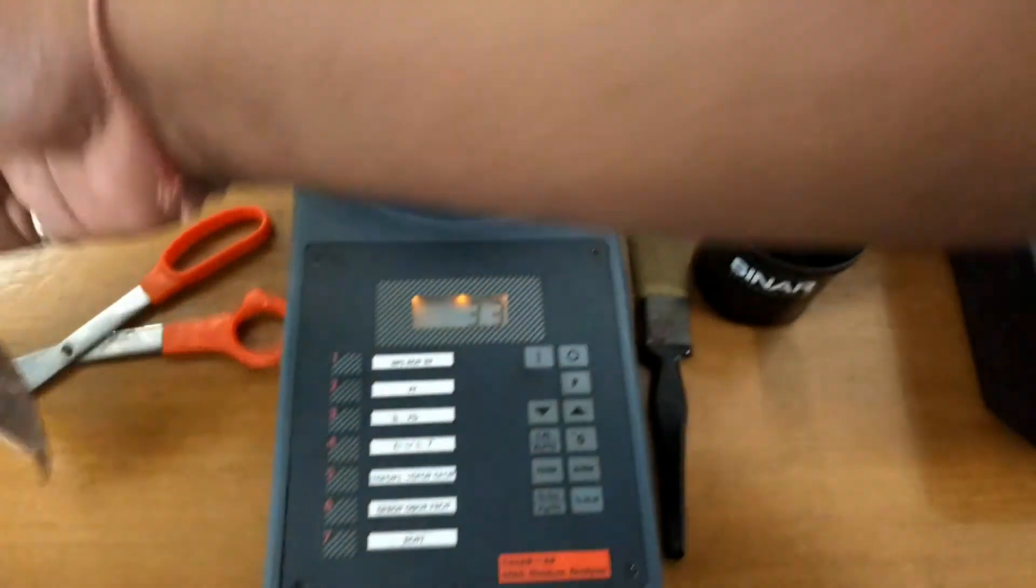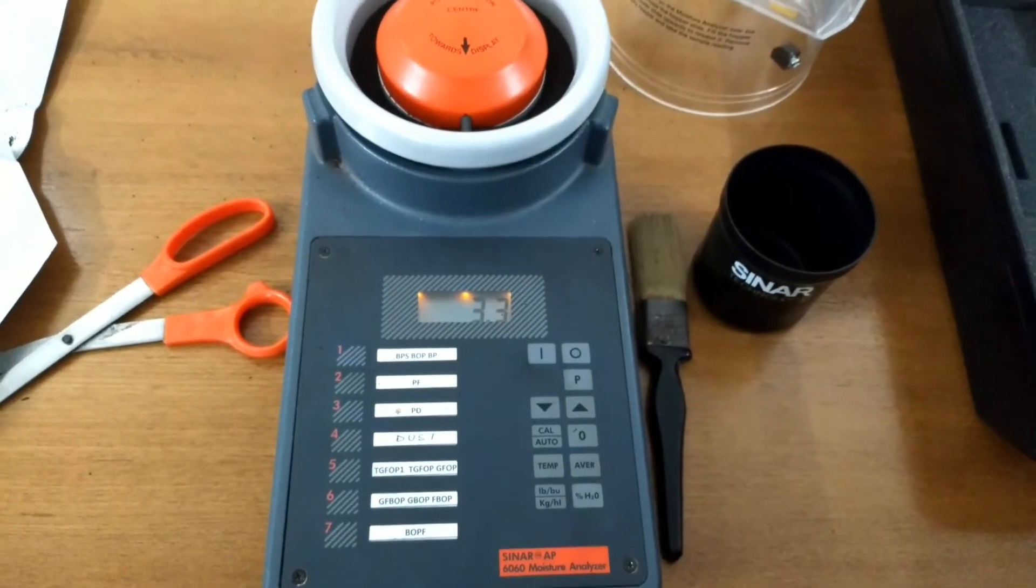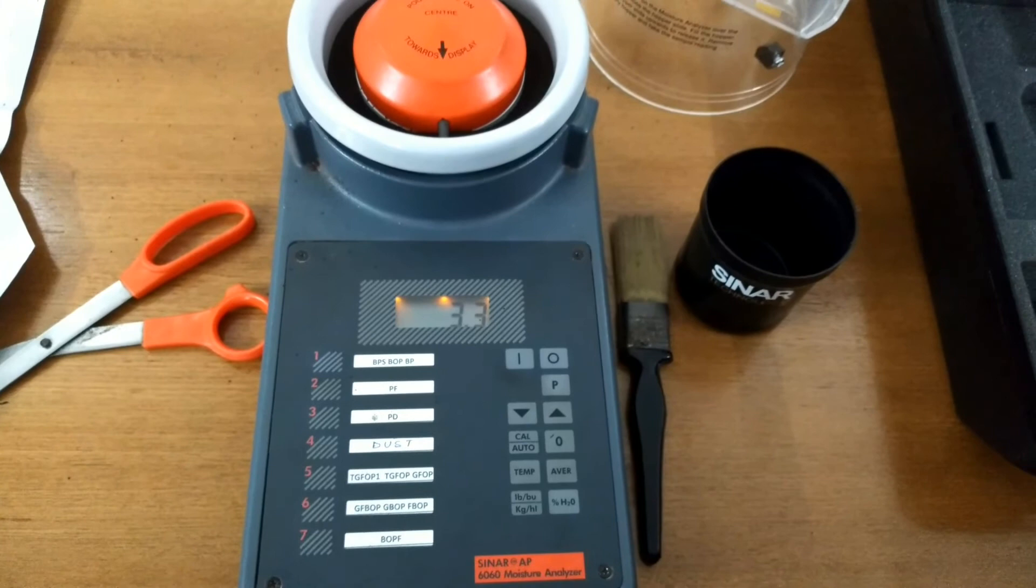All the channels need to be calibrated in similar fashion to match the samples which are generated by the PPC samples.